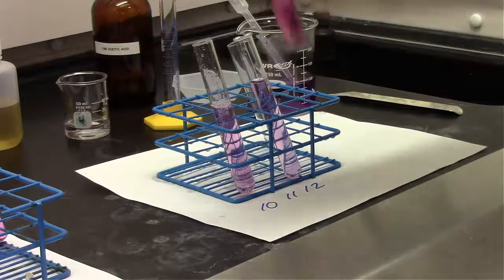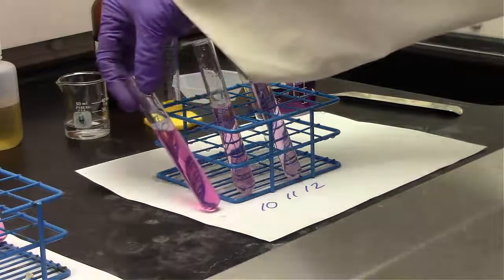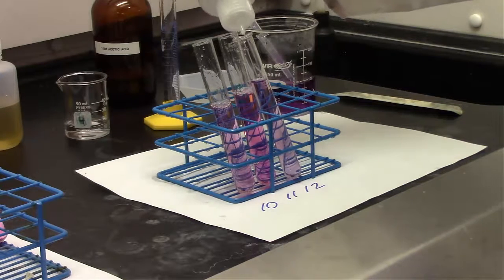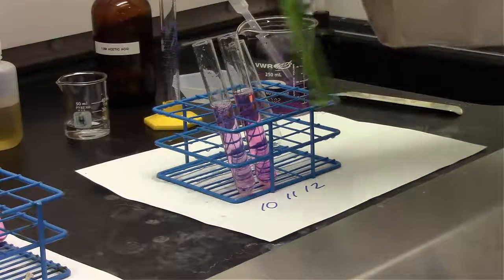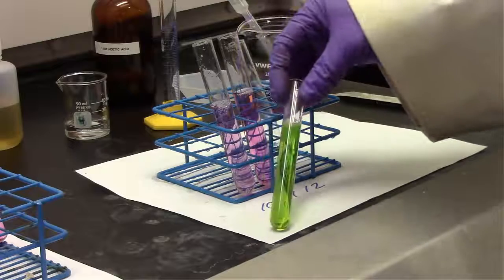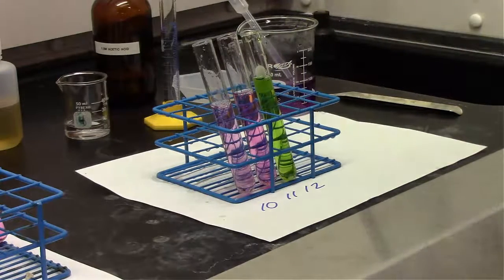For the second test tube, in that case we only had acetic acid, so that acetic acid is going to be partially deprotonated by sodium hydroxide. It looks like it's slightly more basic. Okay, now that we're in equilibrium, it looks like it's gone to just about neutral. And then for the last one, where we only had water in the indicator, 3 drops of sodium hydroxide immediately turned that green. So that's a basic solution for test tube number 12.